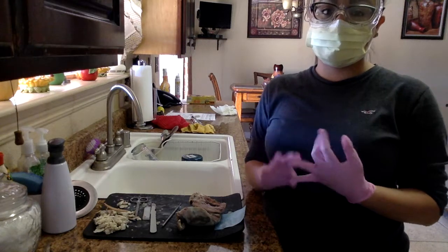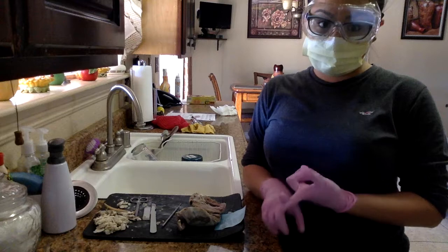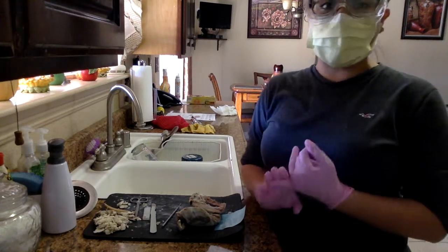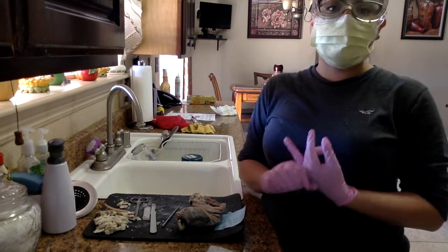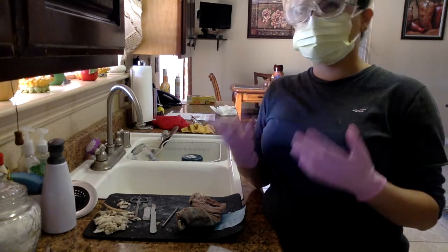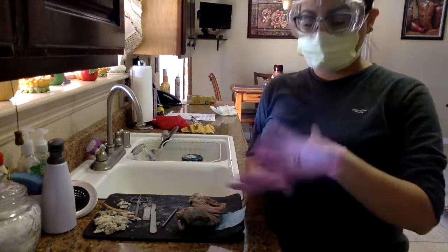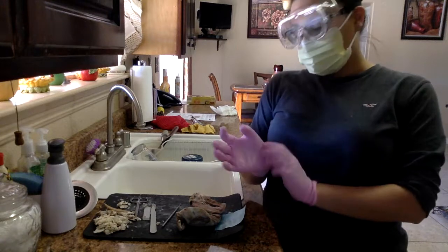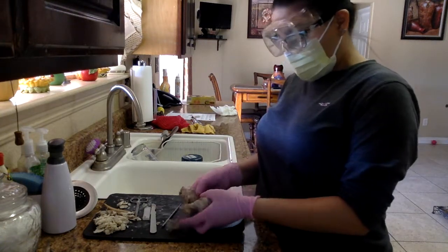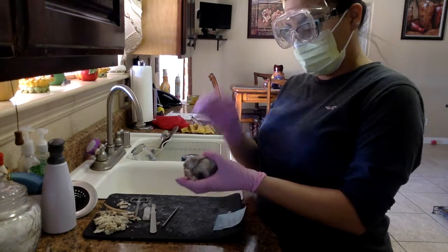It'll be the right atrium, right ventricle, left ventricle, interventricular sulcus, the aorta, the papillary muscles, the tricuspid valve, capillaries, bicuspid valve, and the brachiocephalic artery. I have everything listed here on my paperwork, so I'm ready to go, and hopefully I don't butcher it.